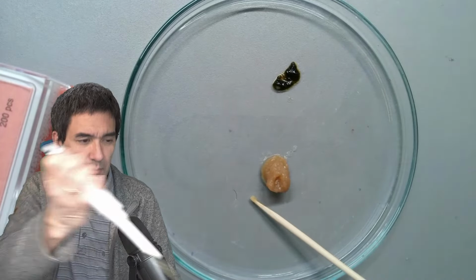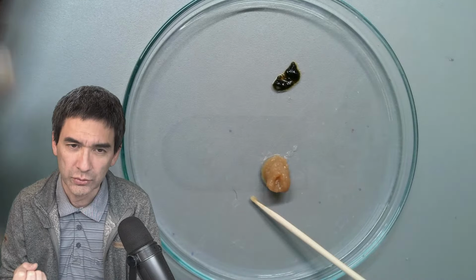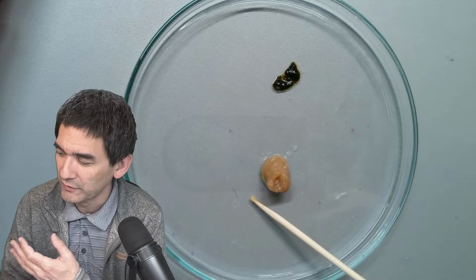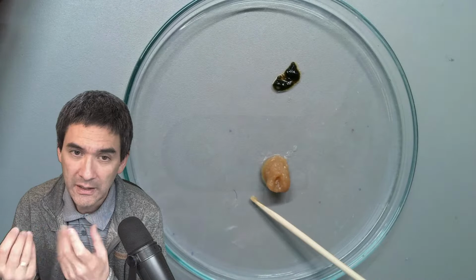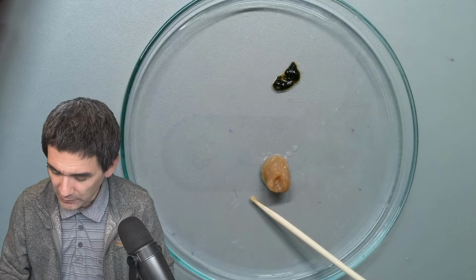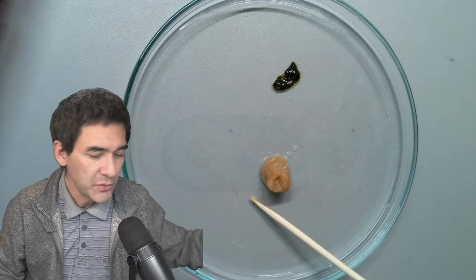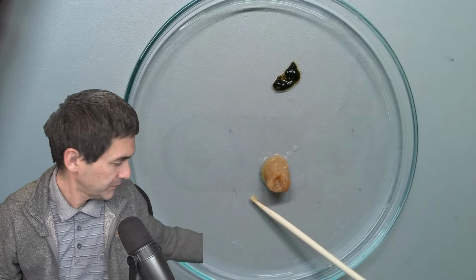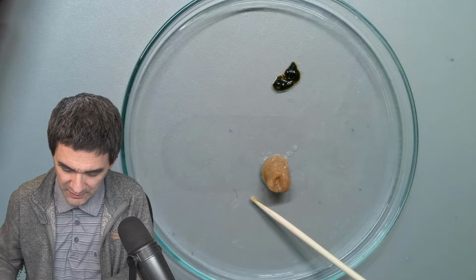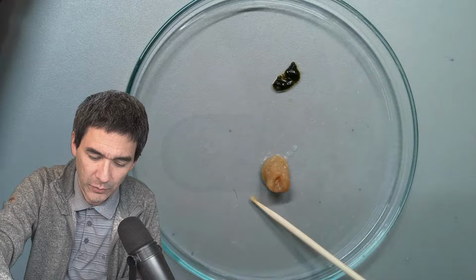One always has to be a little bit careful with iodine because it's quite corrosive. Especially if it touches some parts of the microscope or some metal even, then it likes to corrode. So generally what I sometimes do is simply try to wash away any excess iodine using some water. So I'm going to simply add a little bit of water.